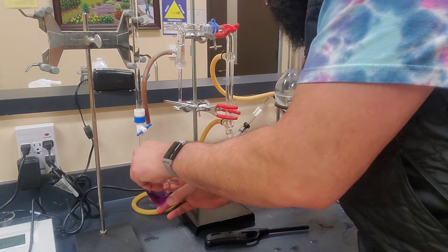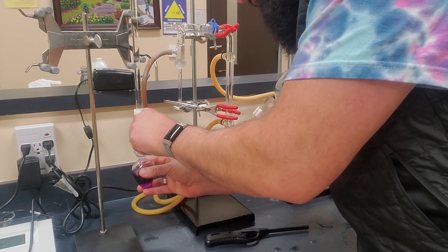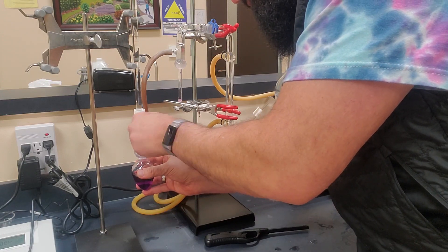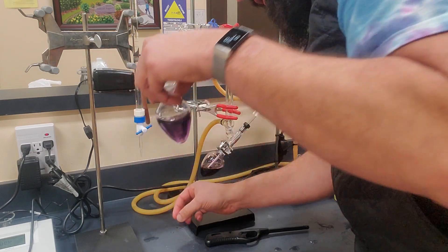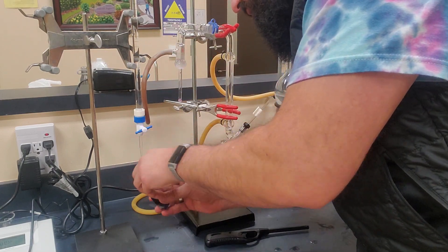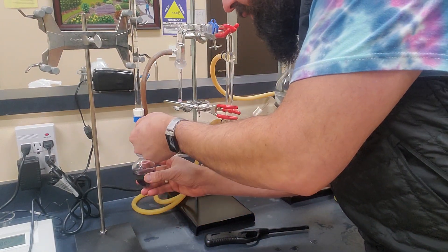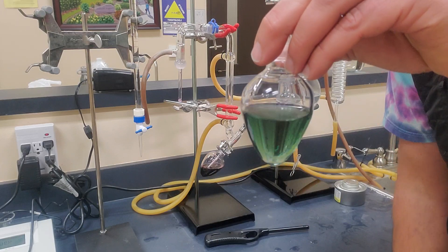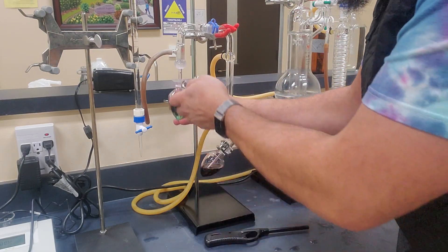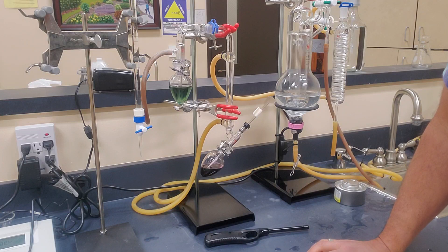And bound SO2s can be more or less depending on how long you let it run. But we're going to go ahead and just do our titration where we're really slow and steady. Again, we started at 10 milliliters. And we're going to go ahead and go through this until we get down to however much we need to get to. Oh, we're already starting to get a little bit less purple. So we're going to go ahead and just do another little turn there. We're in this gray zone. So we're really close. So just one more quick twist will probably get us back to that olive green. And there we are, that beautiful kind of olive green. That's the color we're trying to titrate back to. So we'll take a look up at our burette. And we went from 10 milliliters to 13 milliliters. So that means we have a difference of three milliliters and three times 16 is 48.